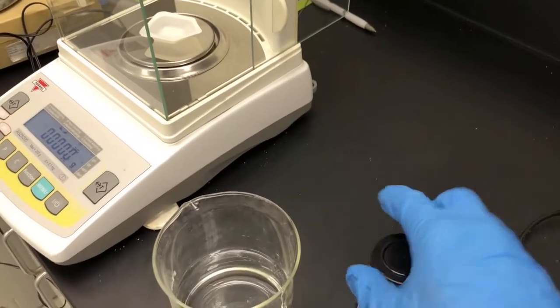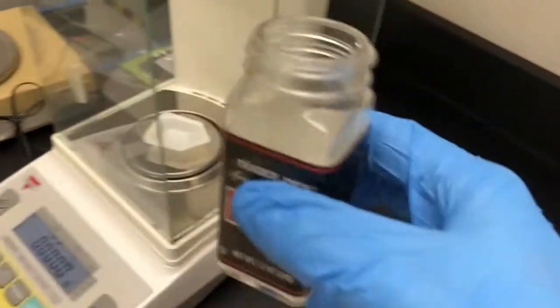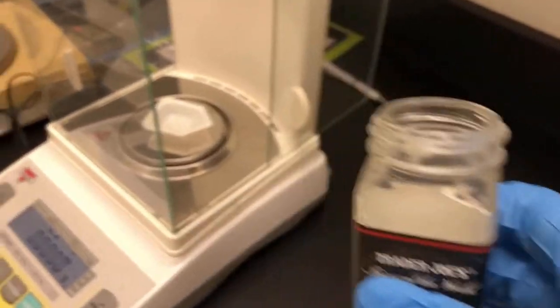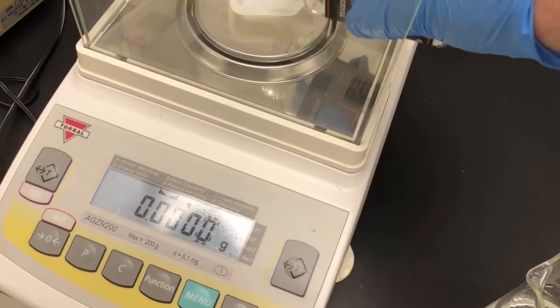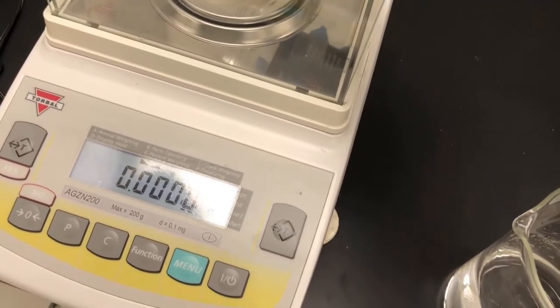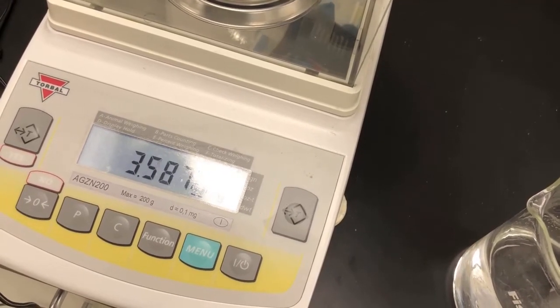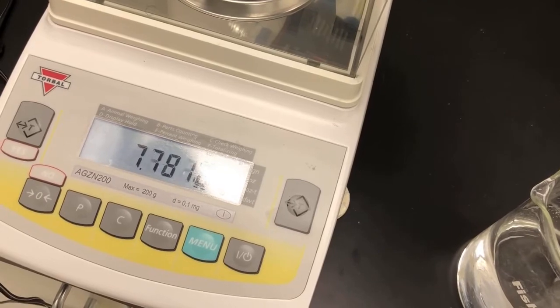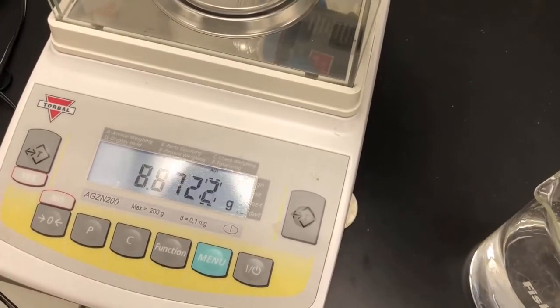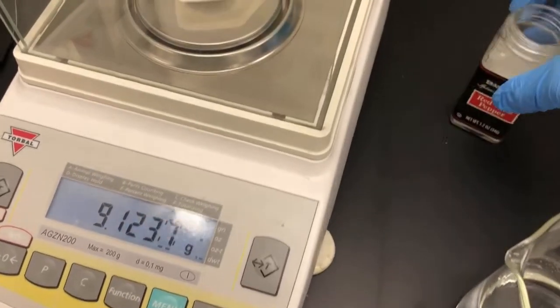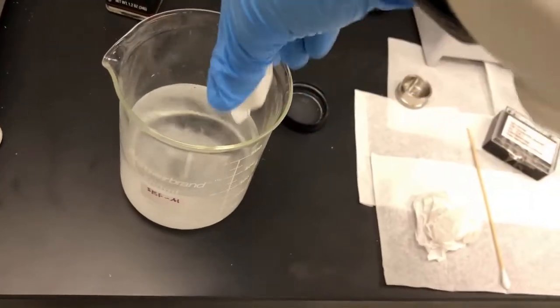A 3% weight solution of salt, NaCl. I've got my lucky salt from Trader Joe's - not red pepper chilies. I need nine grams, so I'm just going to shake it in here and measure out nine grams. Experiments are kind of like cooking. Chemists will hate me for saying that, even though if you're a good experimentalist you're a good chef.